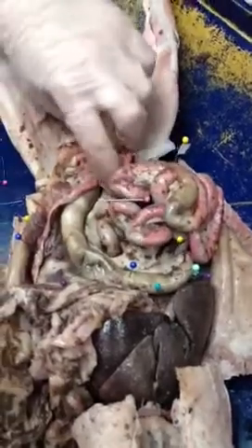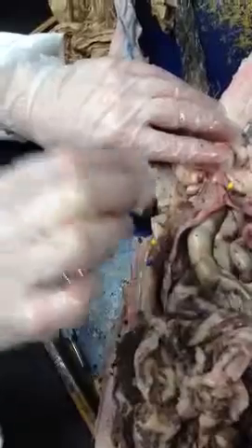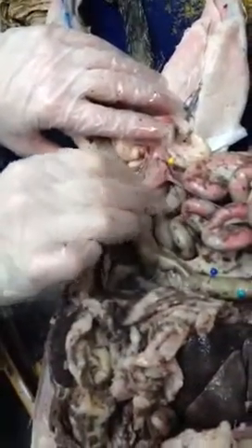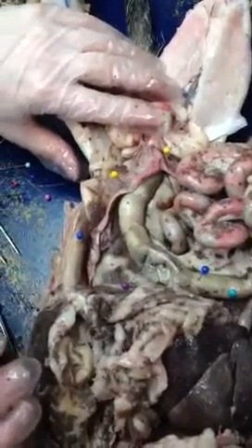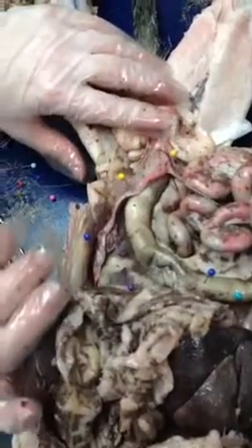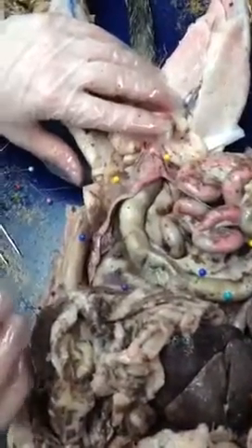Then for the reproductive parts, you have the body of the uterus, the uterine horns, where the kittens develop. They don't develop in the uterus; they develop in the horns. And then the ovaries. I wonder why it's so small. The uterus kind of allows them to pass through, but they don't all grow in there. They all grow in the horns, right there.